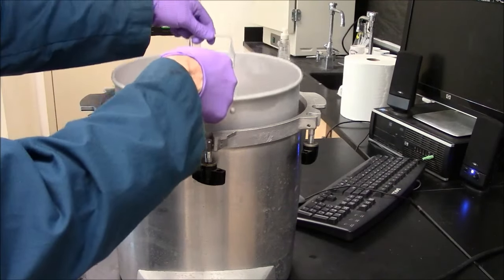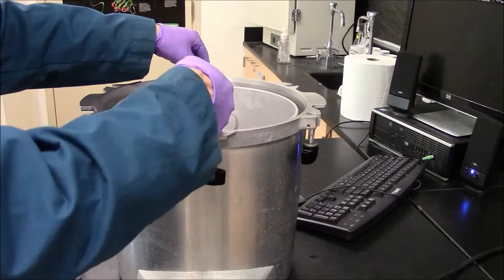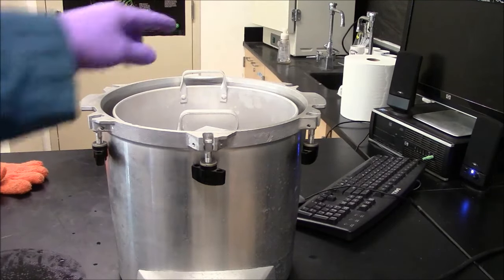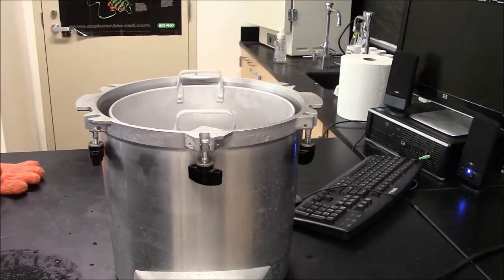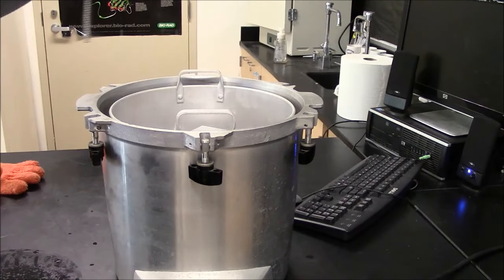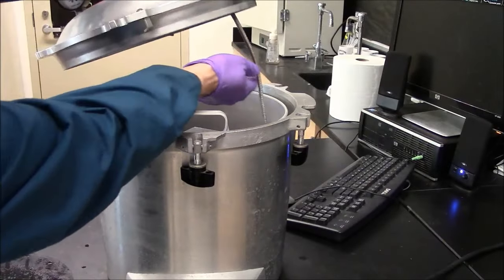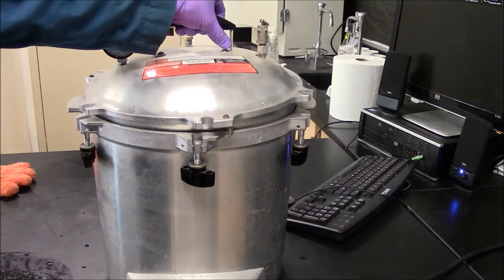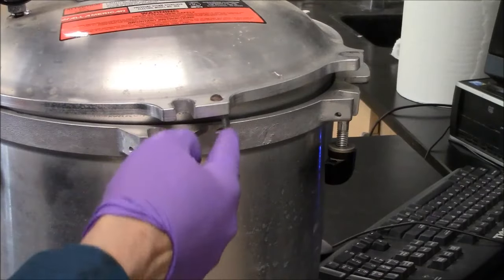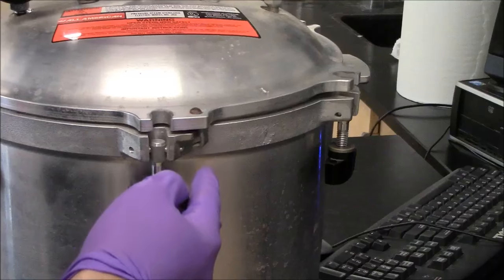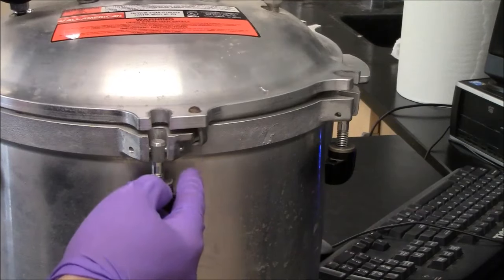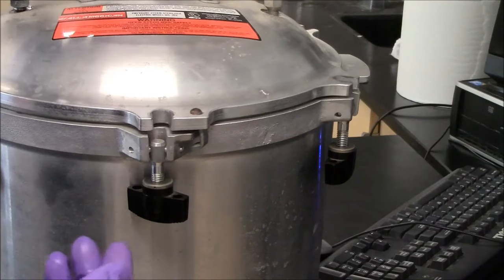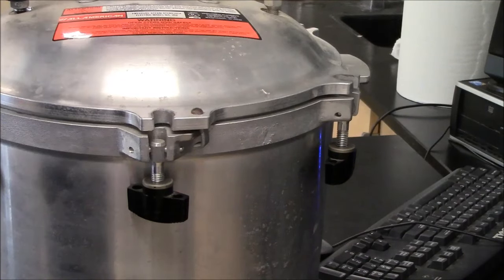I'm carefully putting my sample inside the pressure cooker. I put the channel on the right. So now this tail I'll thread it into that channel. There are these built in hooks here which should interlace with the base. And I'll try to get this fairly well centered.